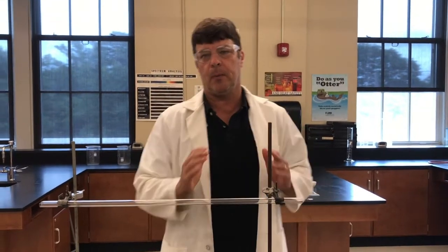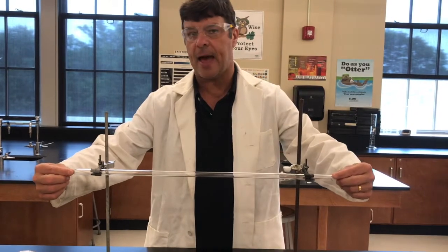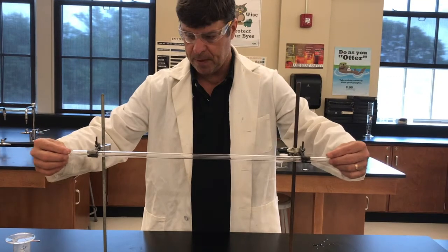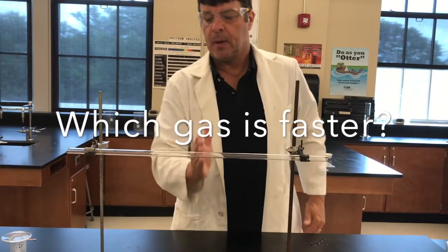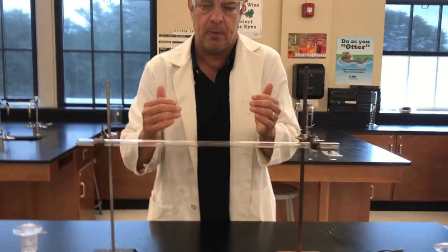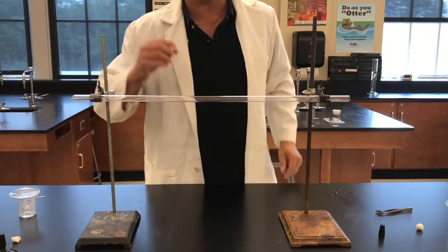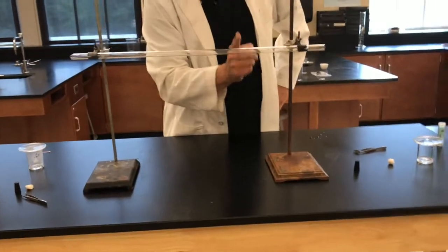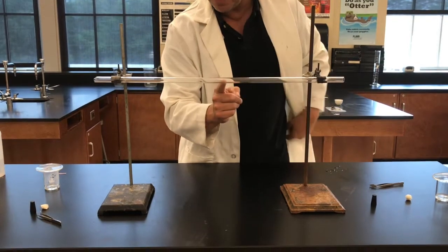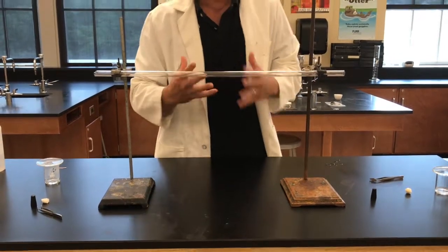So what I want you to do is think about where that ring is going to form. We're going to allow these gases to diffuse through the tube, put them in at the same time. If they meet in the middle, that means they diffuse at the same rate. If the ring forms closer to the ammonia, that means HCl is faster. If it forms in the middle, same speed. If it forms closer to the HCl side, that means ammonia was faster.